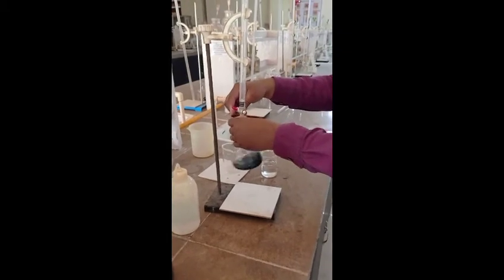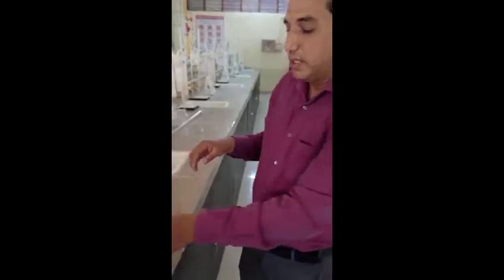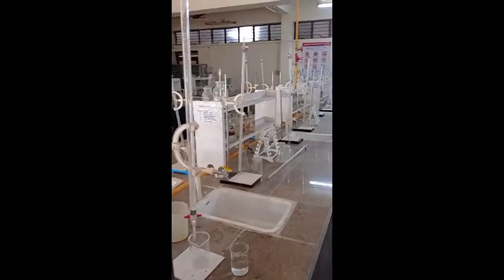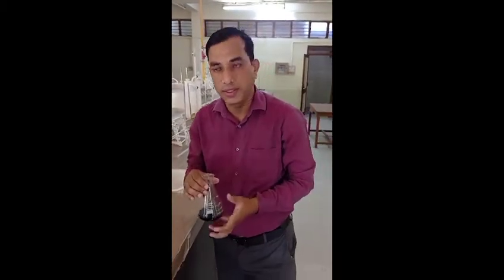The blue color appears — the color changes from wine red to blue. Since it is a complexometric titration, we perform the calculation. The reading is around 29.5. Using this reading, we calculate the total hardness in the water sample. Now the second parameter is alkalinity.